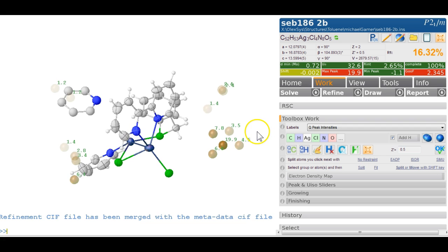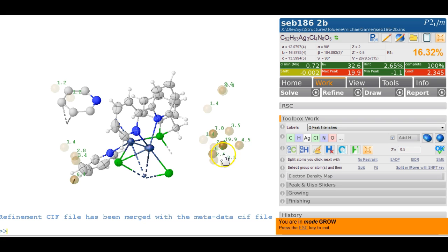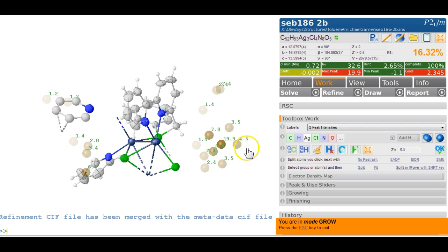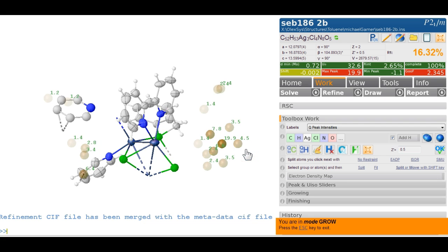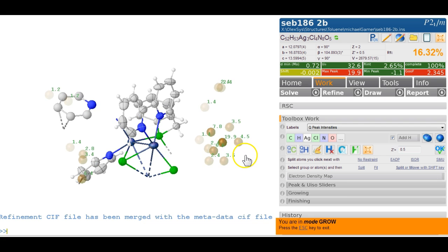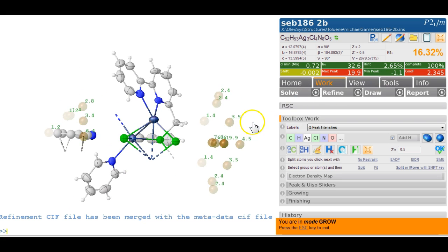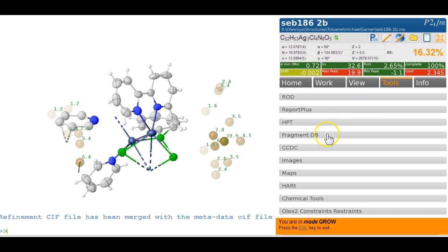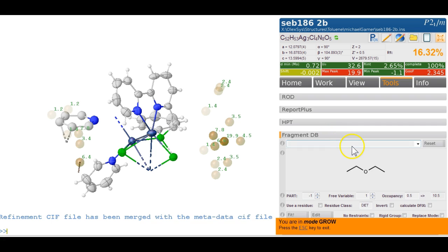There's a perchlorate here. Now let's have a look at this. Yes, that's what I thought. It's all growing into each other. So what I would like to do right now in the beginning here, before we even start on this, is to actually just import that perchlorate, because that doesn't look like a very nice geometry. It looks flat here. It's probably disordered. So rather than starting with the disorder, just head over to the fragment DB and get a perchlorate. Perchlorate. And there we go.